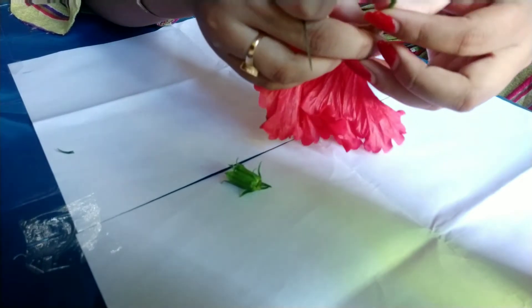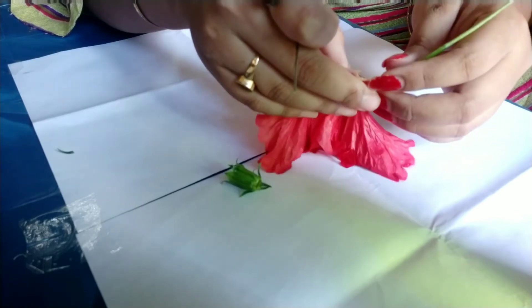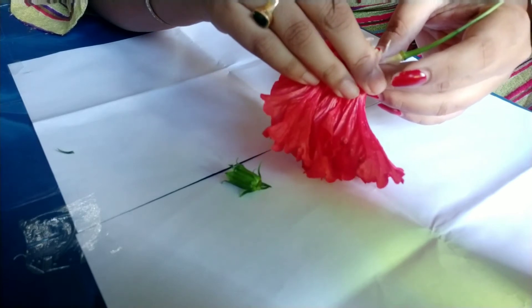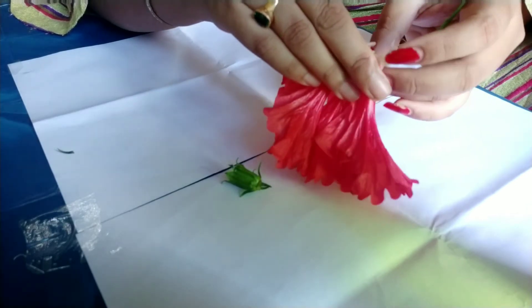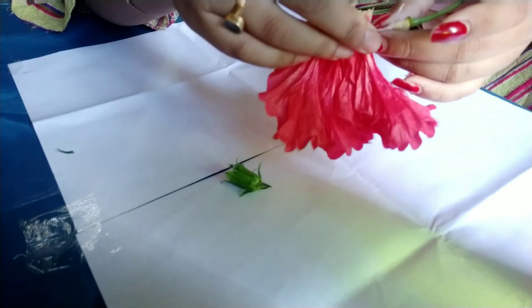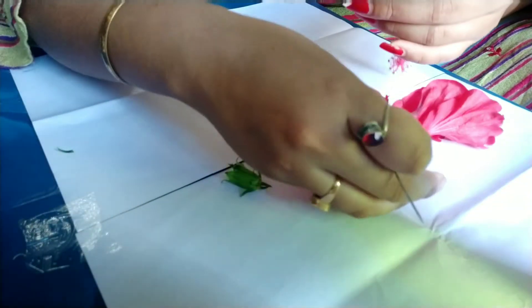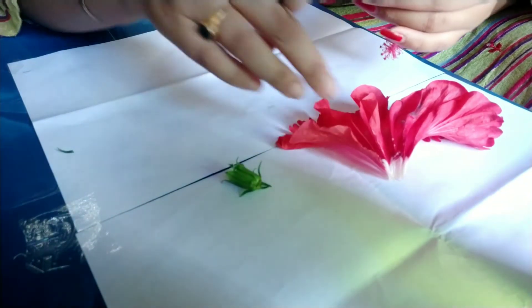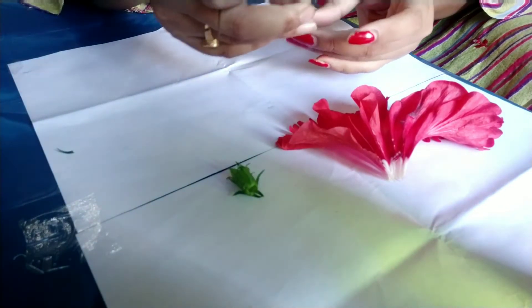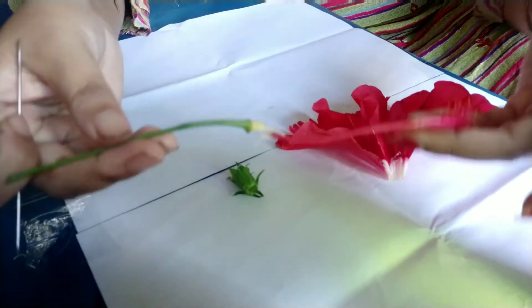This video is going to be longer since I am doing it slowly so that all the parts can be dissected very carefully without cutting much. Can you see the petals? Yes — that's the petals, five petals.